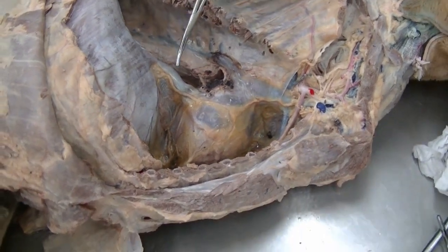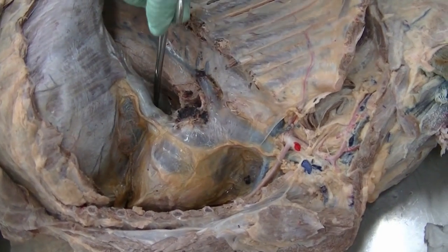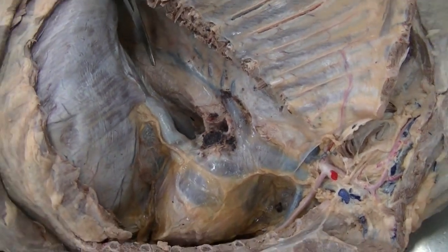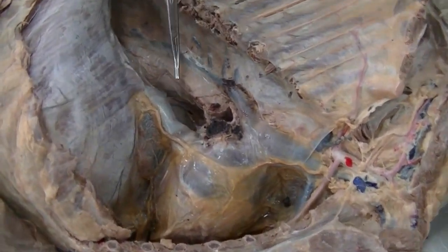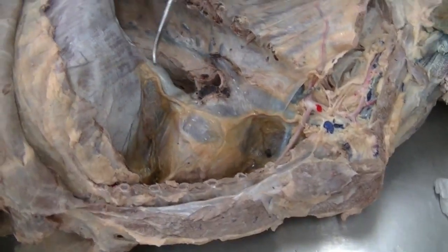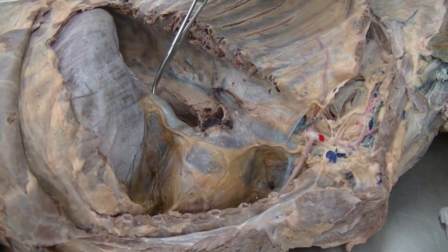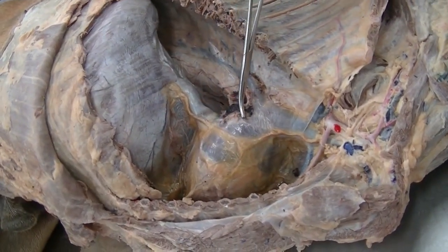Now on the left side, we saw the mediastinum has been pushed more to the left, basically the caudal mediastinum. Here the esophagus and the azygous vein are still in the mediastinum, but from this point ventrally, the mediastinum has been moved more to the left. The caudal vena cava, as it has to come into the right chamber of the heart, is placed more on the right side. So this is your caval foramen, through which the caudal vena cava is coming into the thoracic cavity and joining the right atrium.